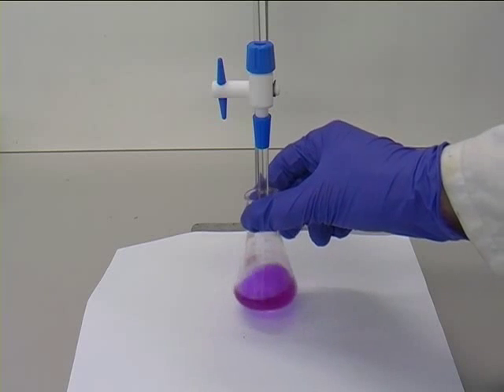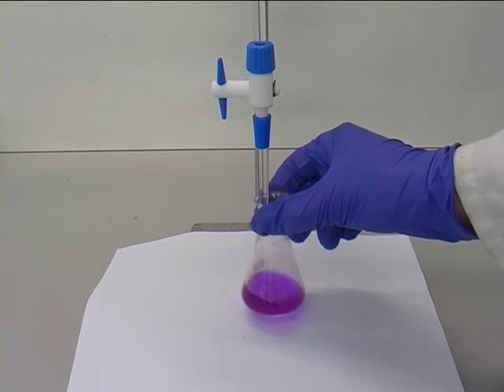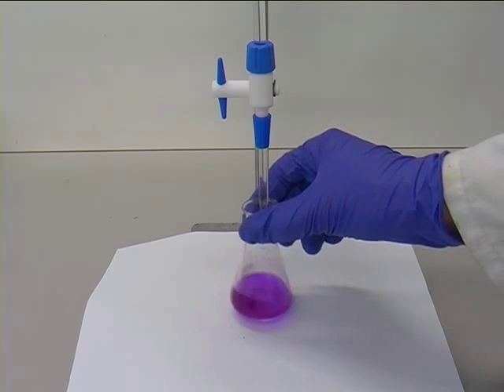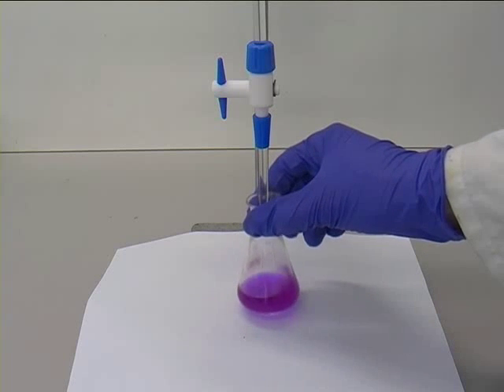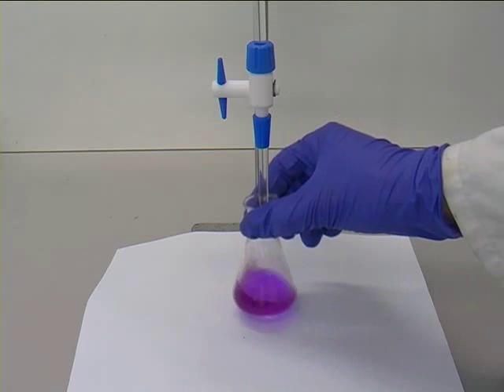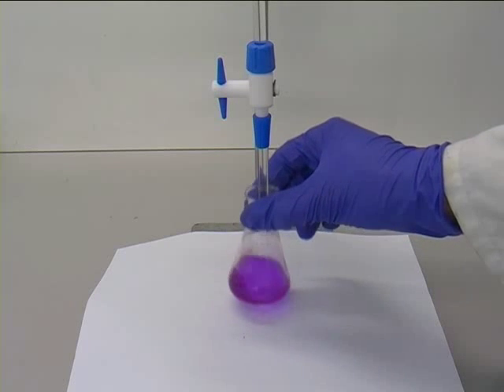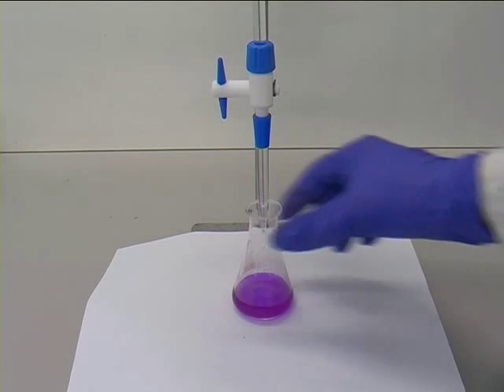You will know when the end point is reached when the indicator changes, in this case from pink to clear. As this is the rough run, accuracy is not such an issue. It is just a rough guide to how much is required.